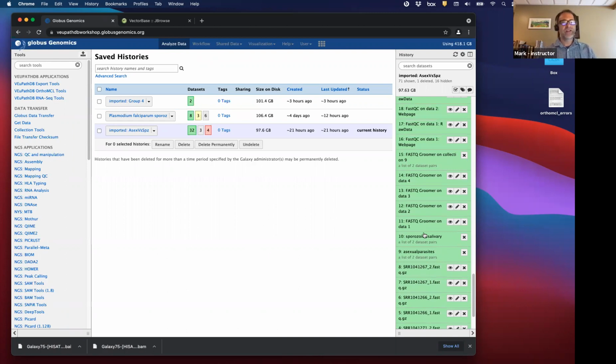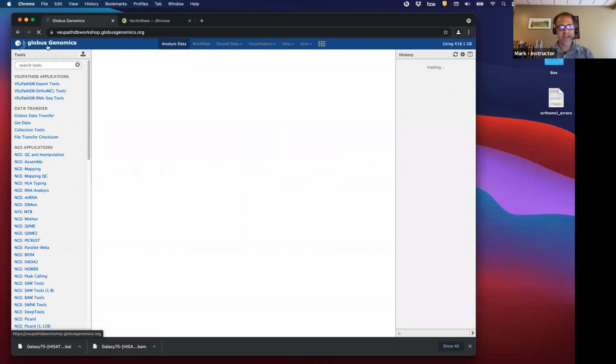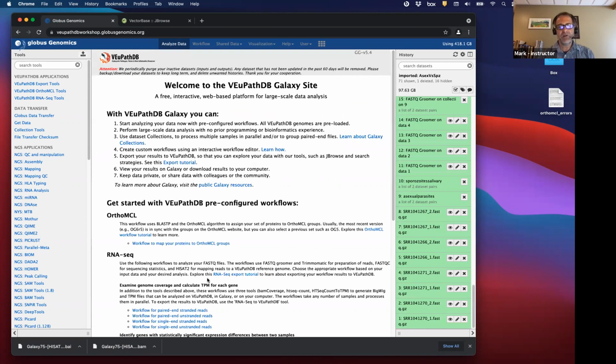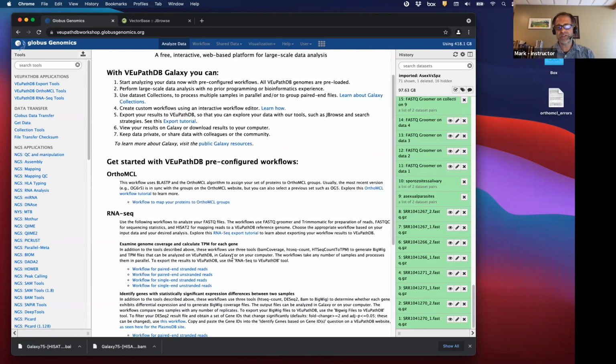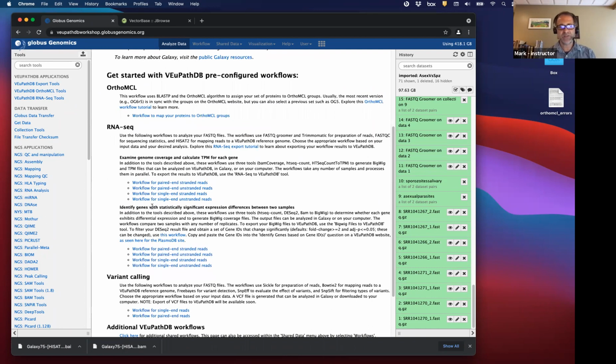Okay, so Catherine explained yesterday how a Galaxy workflow works, and we have these workflows that provide all the steps and all the tools that you need, in order, with the correct settings to do the analysis that you want. And for us, what we were doing is trying to identify genes with statistically significant expression differences between two samples. And I think everyone chose this workflow right here, which has a set of tools to do this.